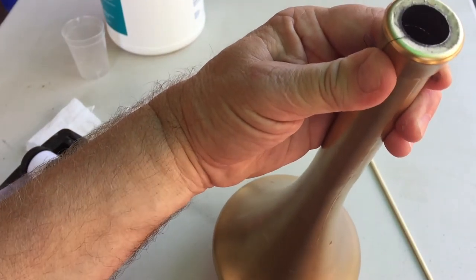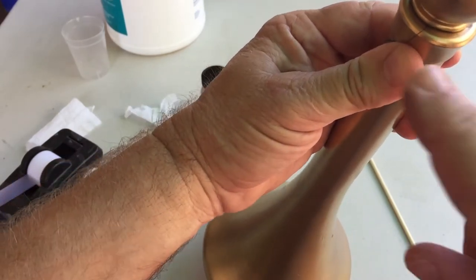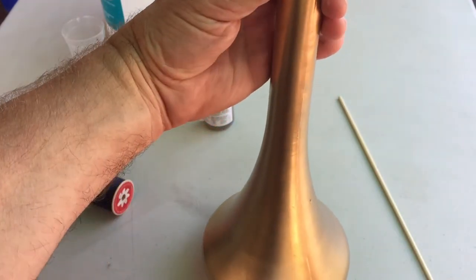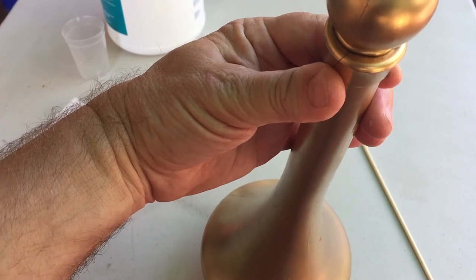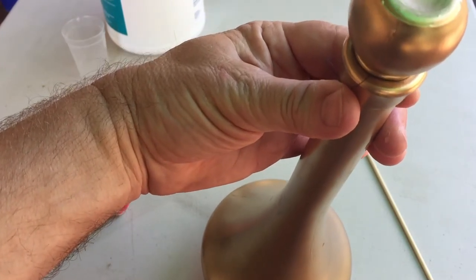So the recap: you've got the thread in, you've got your finger on it, then you put the cork in — that's going to hold the thread in place, holding it right above the hydrogen peroxide. When you're ready to release, like when I had Gracie rub the bottle, I opened it up, released the thread, and that's when it fell in and the reaction occurs.